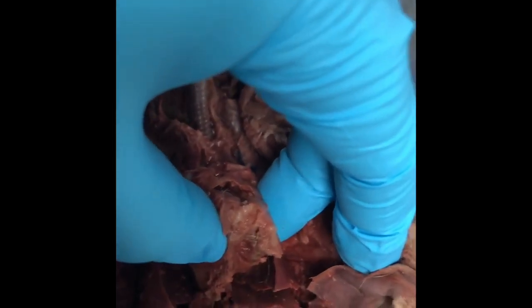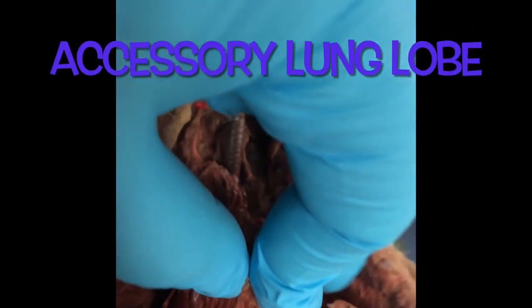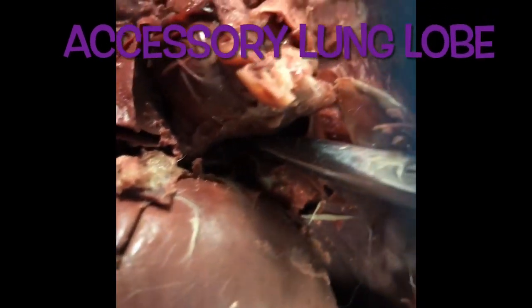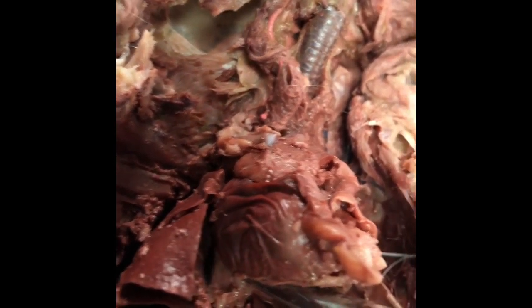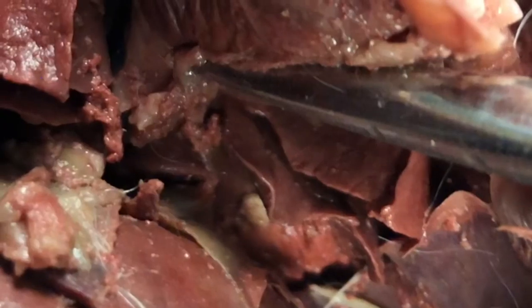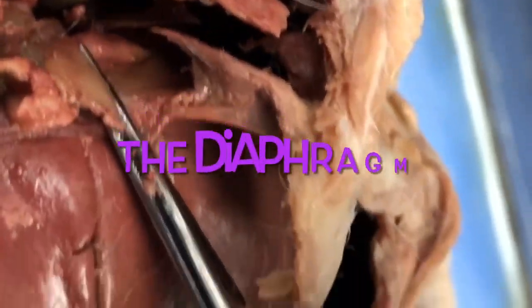Now I'm lifting up the heart to show you the accessory lung lobe. It's this tiny lobe tucked underneath where the heart is. Here's a closer look at the accessory lung lobe.